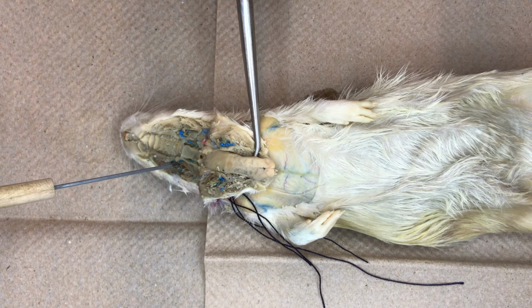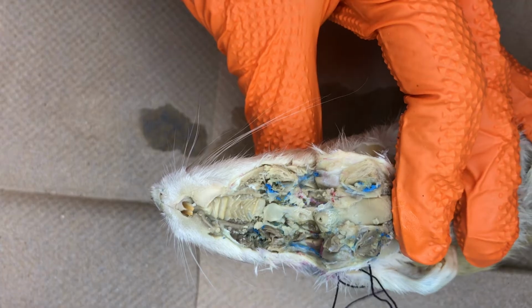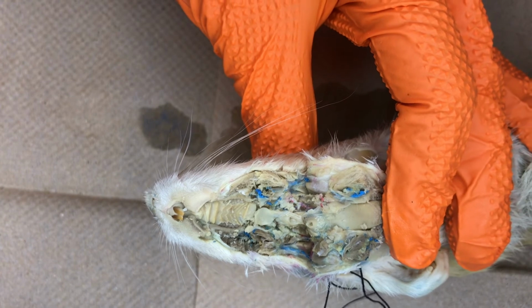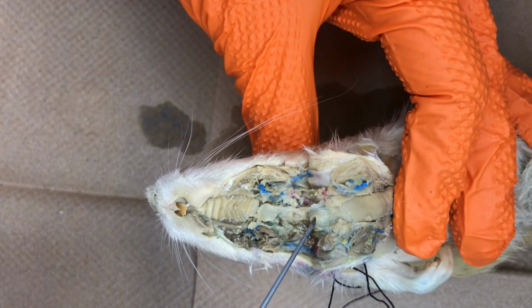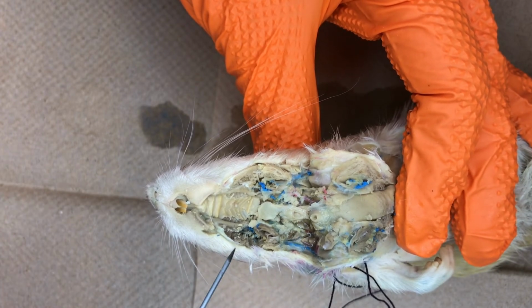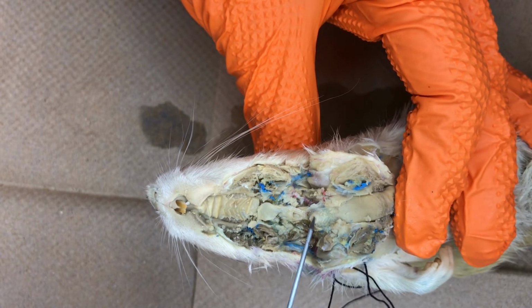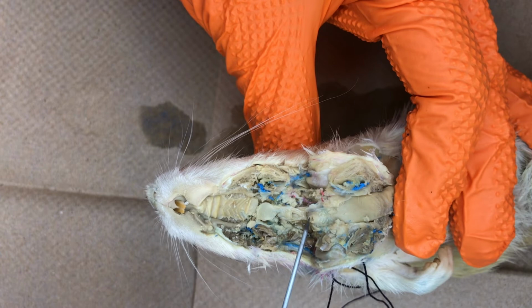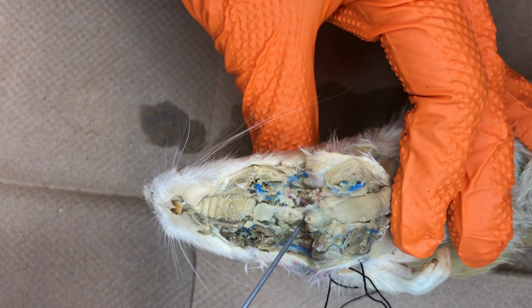Located above the soft palate is the nasopharynx, the passageway that connects the pharynx with the nasal cavities. Also, in the mouth cavity, we can see the glottis, the opening into the larynx and trachea. The opening is covered by a triangular flap of tissue, the epiglottis. Behind and dorsal to the glottis is the opening into the esophagus.